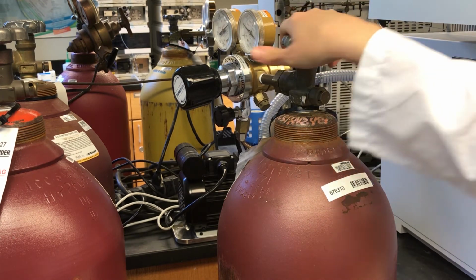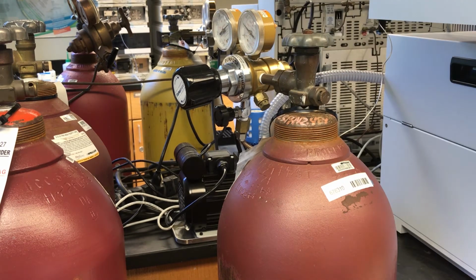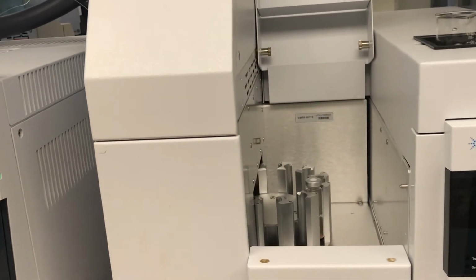And once the samples have heated and come to a certain pressure, then the sampling happens from that vial. So this nitrogen produces that pressure inside the vial. This sort of forces the sample into the transfer line. Okay, so we've got our sample in position 1.